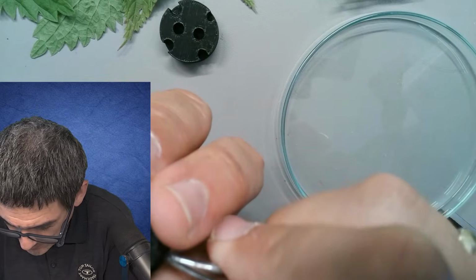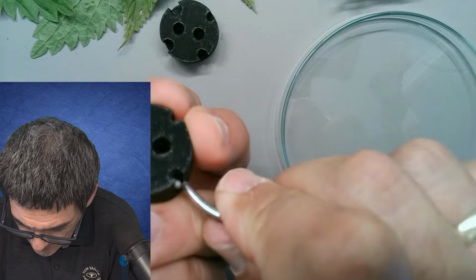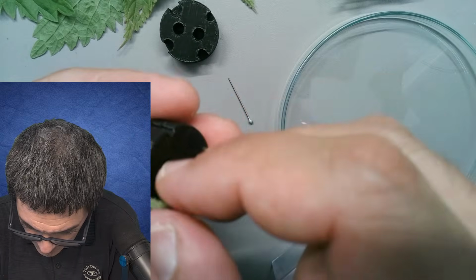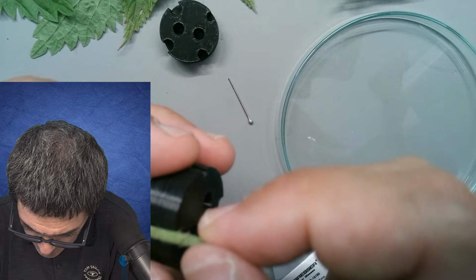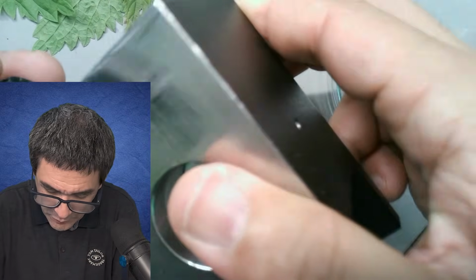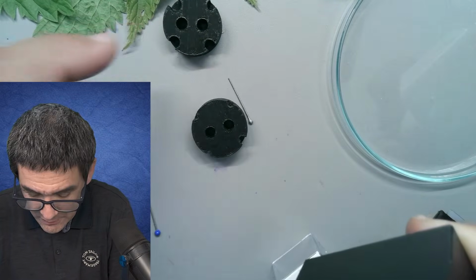Yeah, the pin is now not long enough. Okay, so this is a little bit of an issue. Not to worry. I'm just going to put it back into this one over here. No, which one was it? This one over here, maybe. No, let's do this one. It's a little bit tighter. And I'll put it now into the microtome. It fell out.